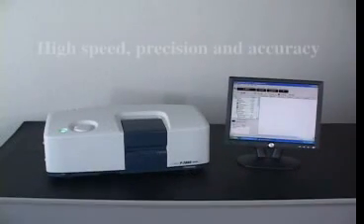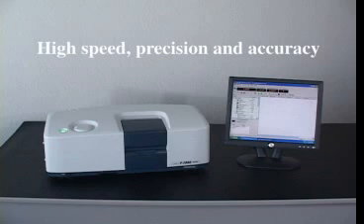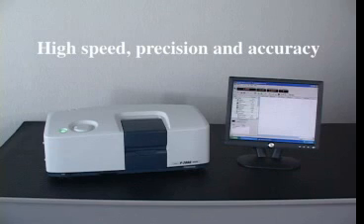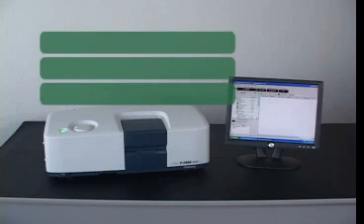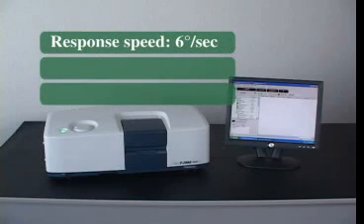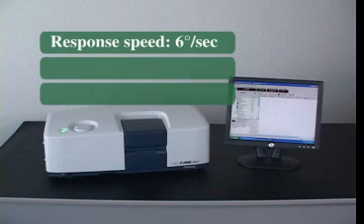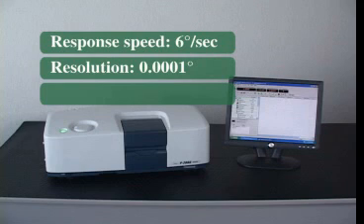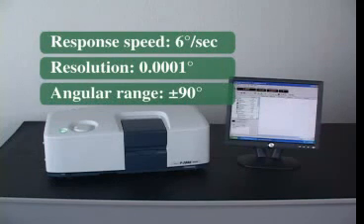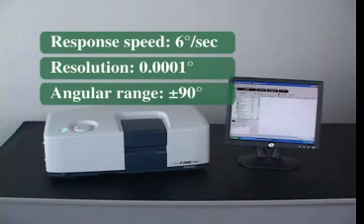The P2000 series has the highest performance specifications available in today's market, offering complete validation including accuracy, rotation, wavelength, and cell path. Additionally, the P2000 has a response speed as fast as 6 degrees per second to provide reproducible data for each measurement with a resolution of a tenth of a milli-degree. A wide dynamic range of up to 90 degrees enables the system to measure chiral compounds over a broad range of concentrations.